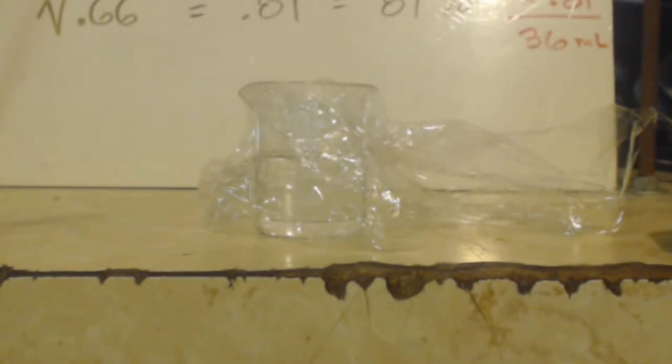Keep in mind, when you try to scale this up, that's how people blow up doing this reaction, because it's so exothermic, and you think you can double the amount of ice that you need because you doubled the reactants. It doesn't work that way. You might double the reactants, but you need 10 times as much ice.